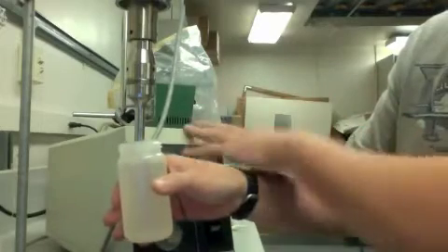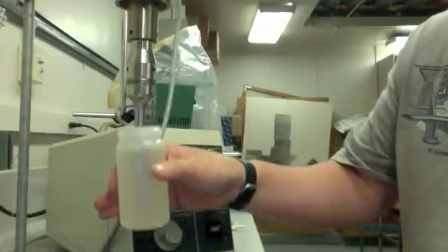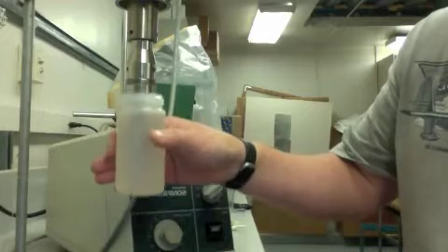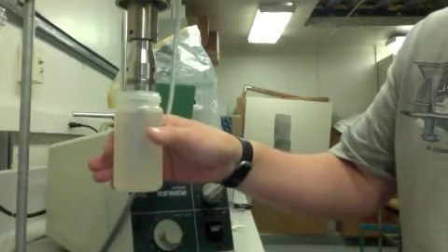And turning on this little sonicator and basically moving this up and down at about 60% output on this little dial and go up and down and let this go through for about 5 minutes.